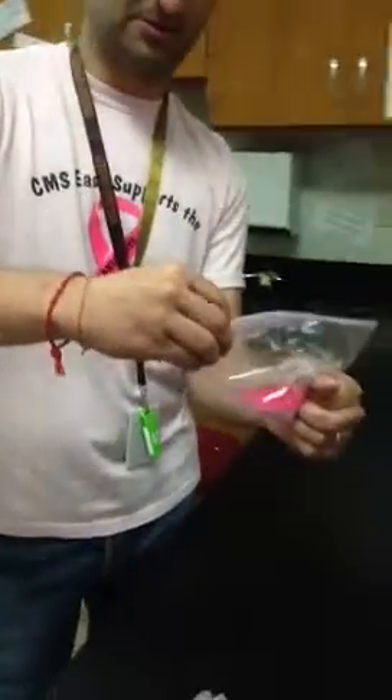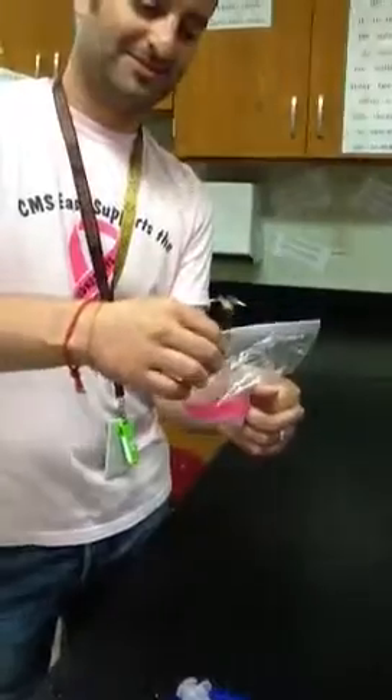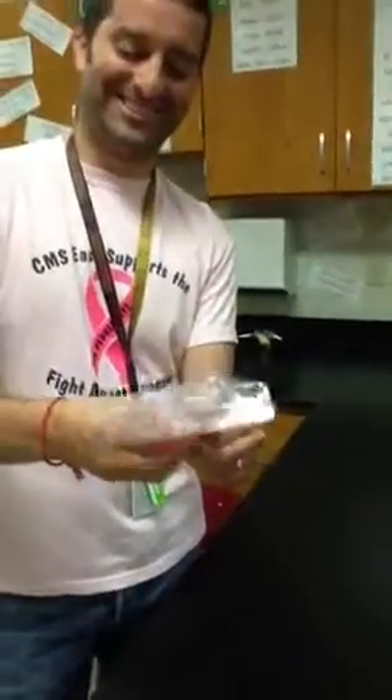Not only did you feel it — just like that — and I just got it over my clothes. Make sure you seal it. When you seal it, you should feel a temperature change and, of course, you see a color change with it too. So two indicators lead you to believe a chemical reaction took place.